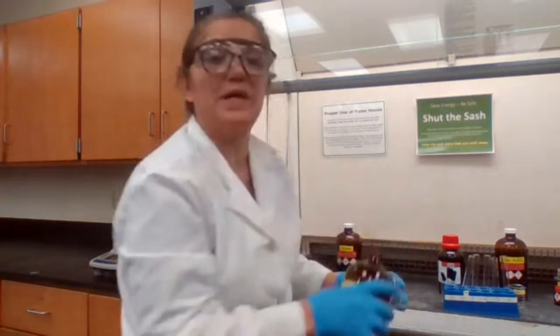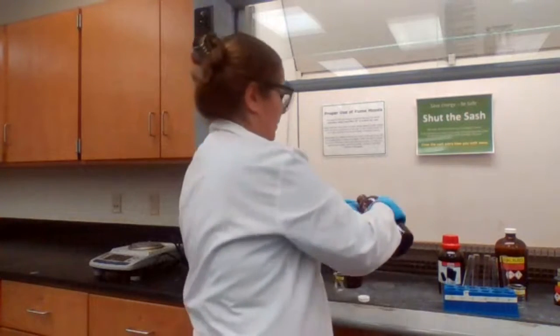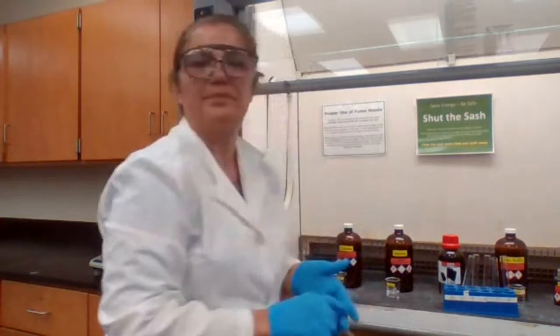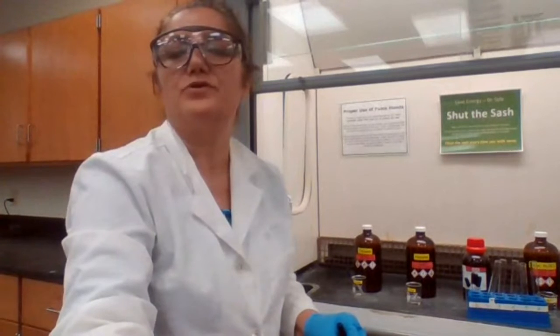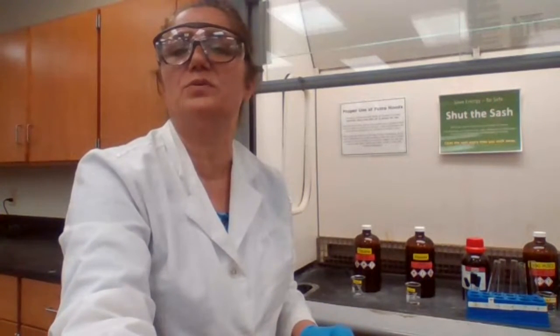I know the steps, but I want to make sure I get the answer from you, so it counts for your participation. And you also know which page you should look for the procedure. Okay, what should I do? I'm trying to do the solubility in sulfuric acid. What is the procedure? What should I do?